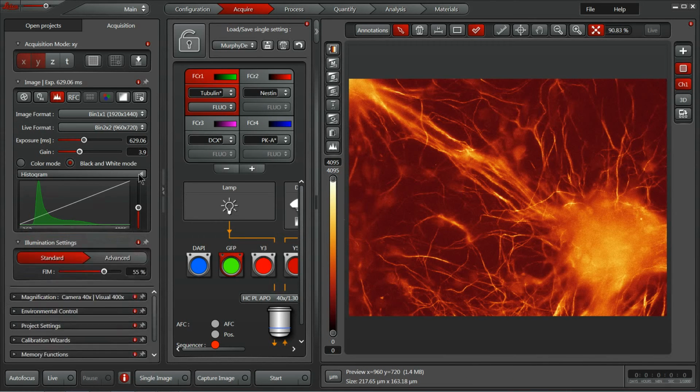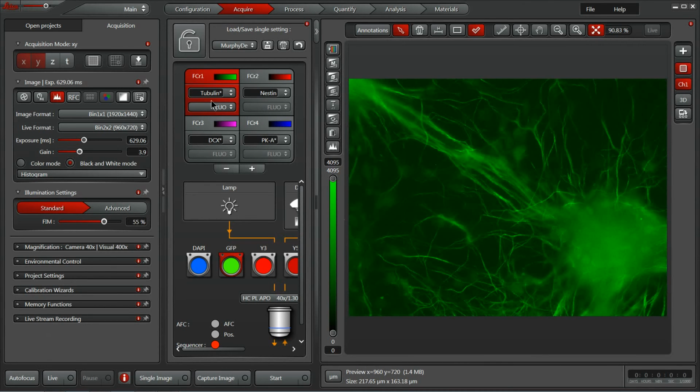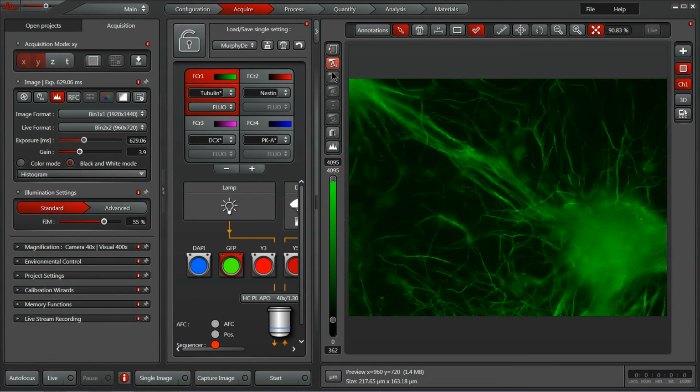Last but not least, as I've traveled around, I've had my users teach me a neat little trick as well. If I go back to my traditional pseudo-coloring here for this channel in green, and I turn on my auto scale located directly beneath that button, now the display is going to automatically jump between the highest and lowest value pixels indicated by these little balls here. So if I hit live on my system now, I can see that I've got some saturation with that top knob sitting directly on that high value. So as I start to bring these values down, we'll see it bounce around the 70-80% mark here. So we're filling about 80% of our pixels.